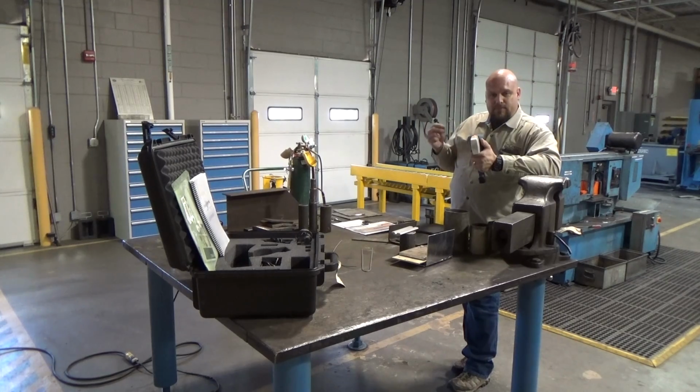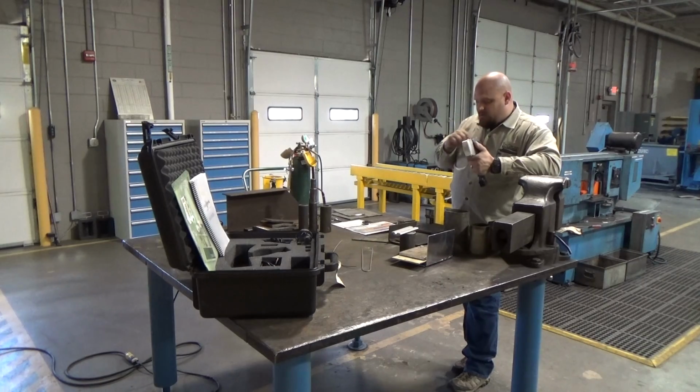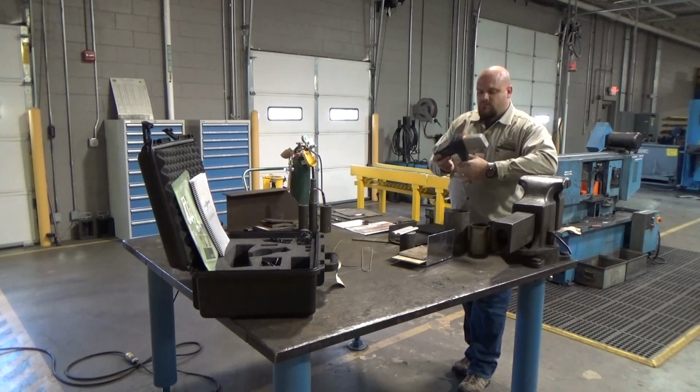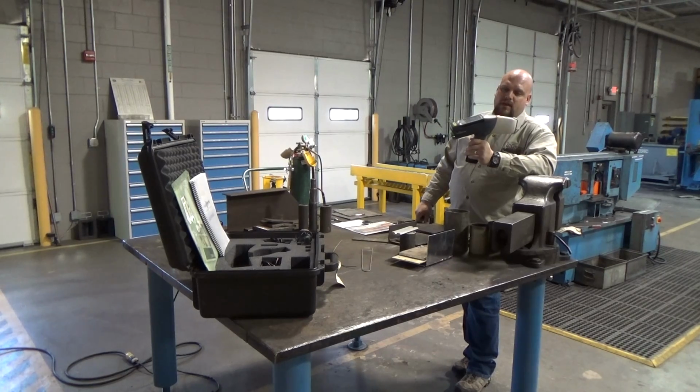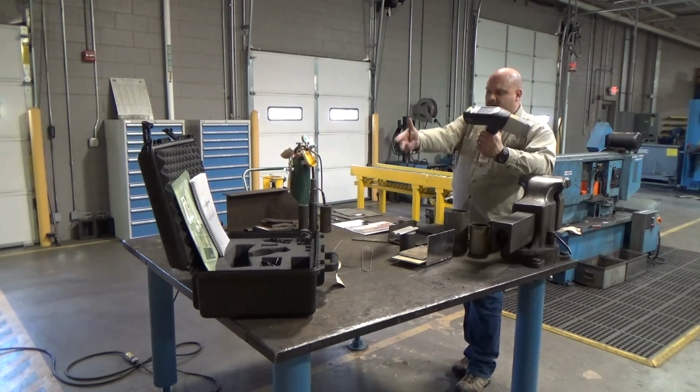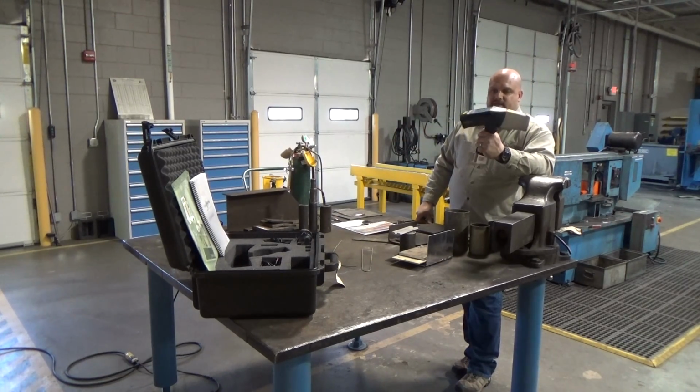If it's not a precise match, it will go through and show you to what percentage it's close to, what it's very similar to. So it's an excellent piece of equipment, but there are some limitations. This item, when it was purchased, was a $32,000 or $35,000 piece of equipment. You know, it came in a complete case and set, very nice.